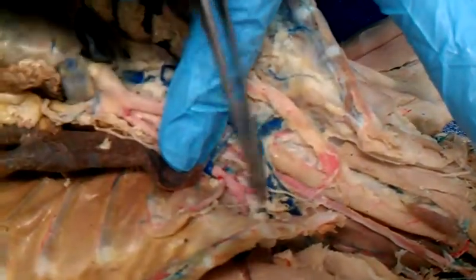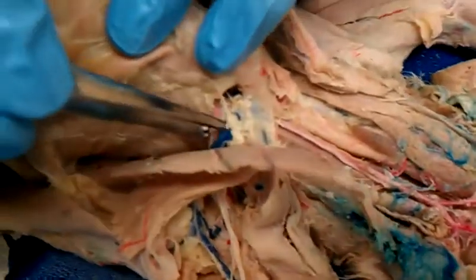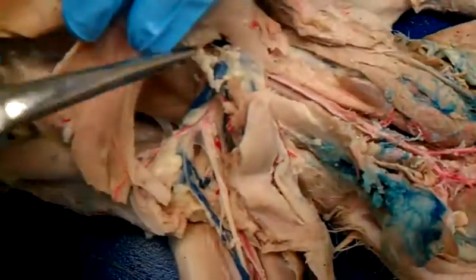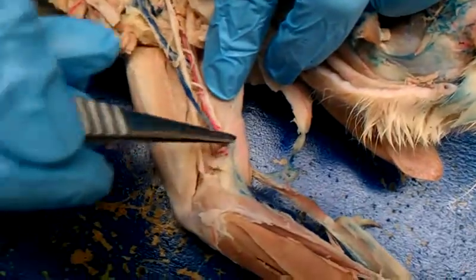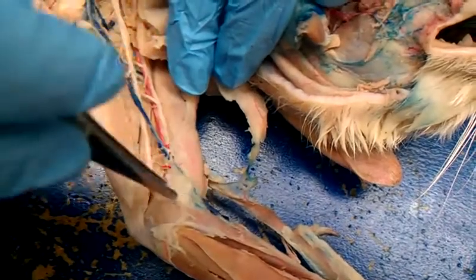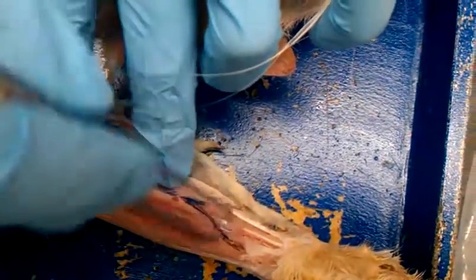This, before you go through the chest wall, is going to be axillary. And then on the opposite side, it turns into subscapular. Then, if we follow that down, I believe this is brachial. Mm-hmm. Yeah, brachial. Then, right around here somewhere, I don't really know where it's at, is the supracondylar foramen, right around the elbow. And then over here it splits off in two directions. This is going to be radial and this is going to be ulnar.